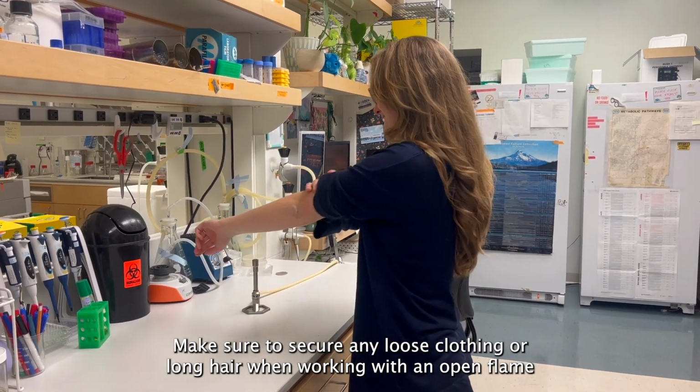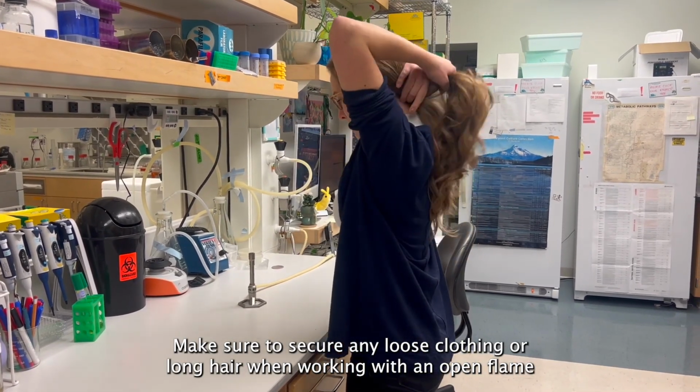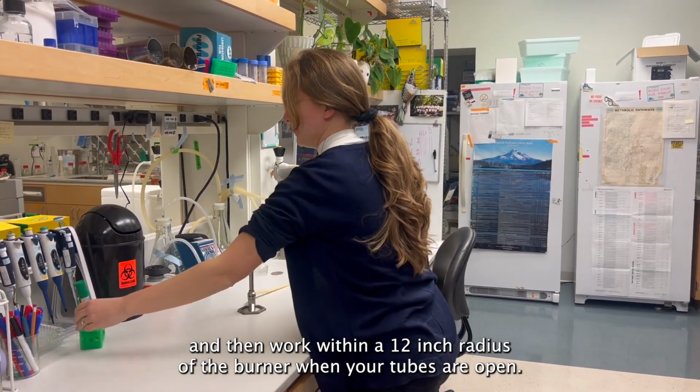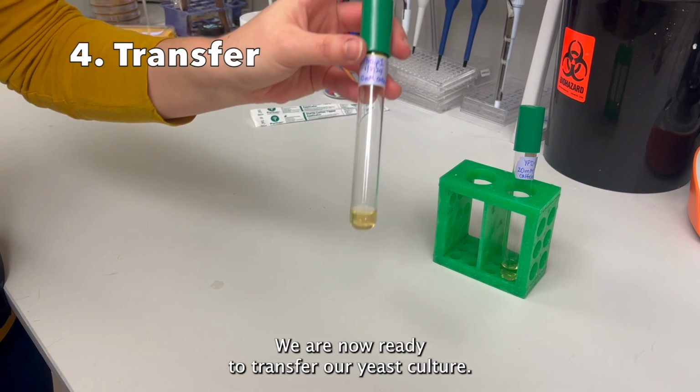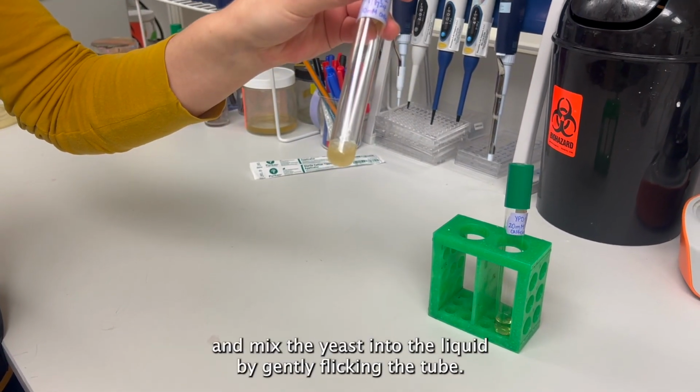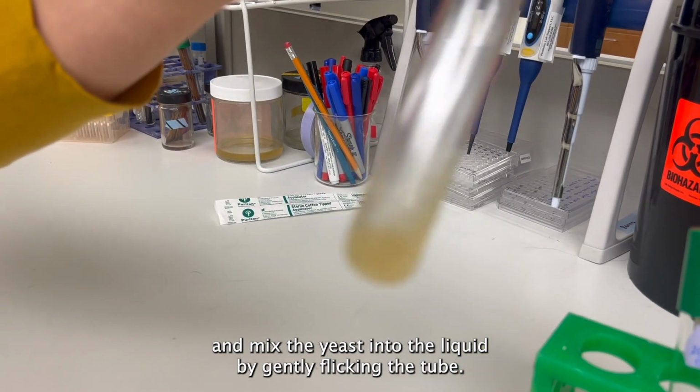Make sure to secure any loose clothing or long hair when working with an open flame, and then work within a 12-inch radius of the burner when your tubes are open. We are now ready to transfer our yeast culture. We take the tube of yeast that we grew previously and mix the yeast into the liquid by gently flicking the tube.